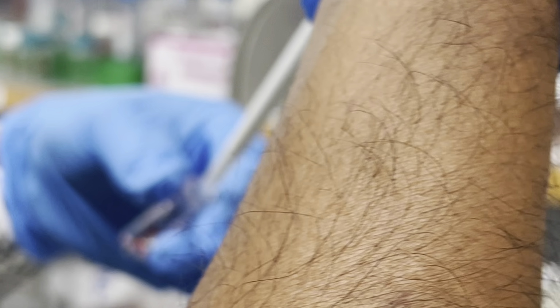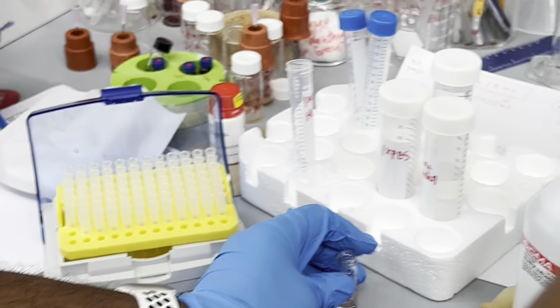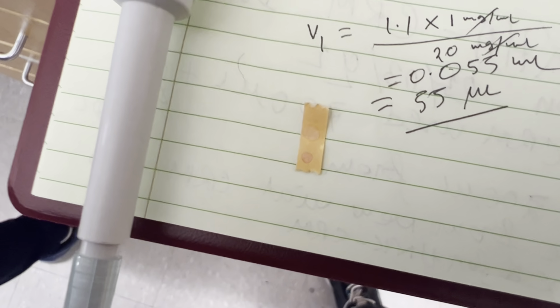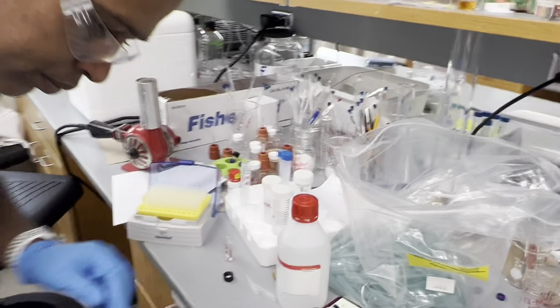So I'm using it the third time. Okay. Damn. Look at the hair on that arm. Does it usually take a few times? Yeah, because you don't want to overdo it. Okay, maybe can you put it down? Let me see if that works. There we go. Yeah. What am I looking at? The color is getting changed. It's supposed to be what, 5-ish? 5, yes. Looks enough the same to me.